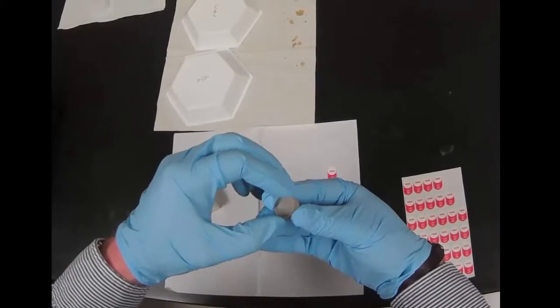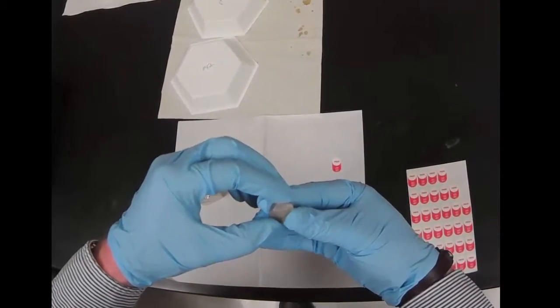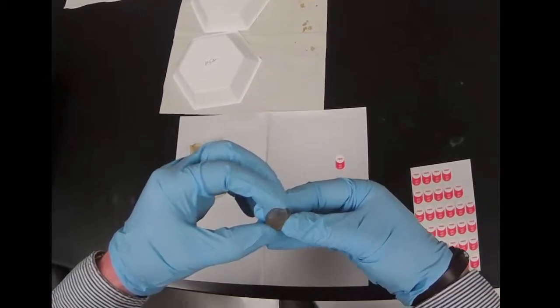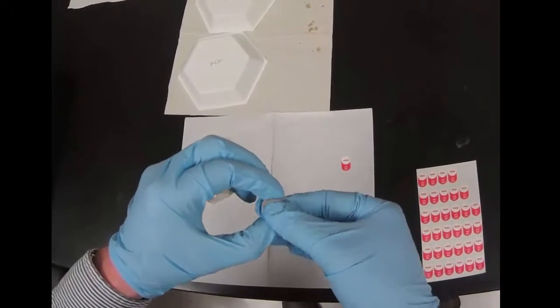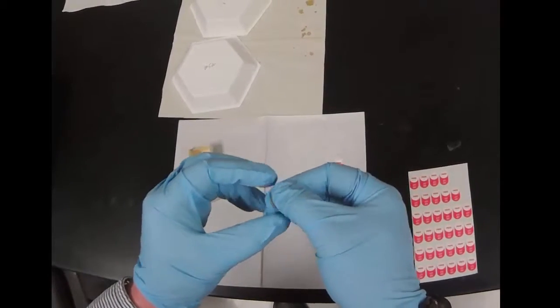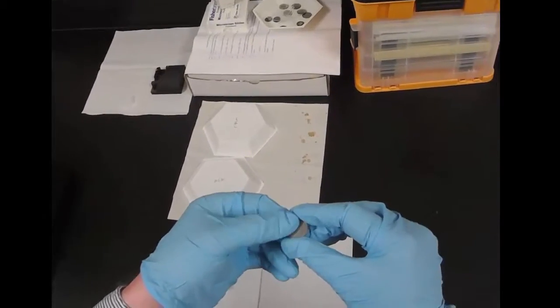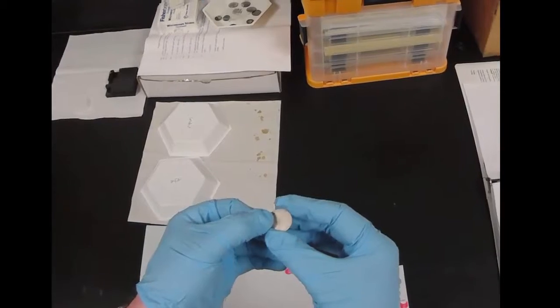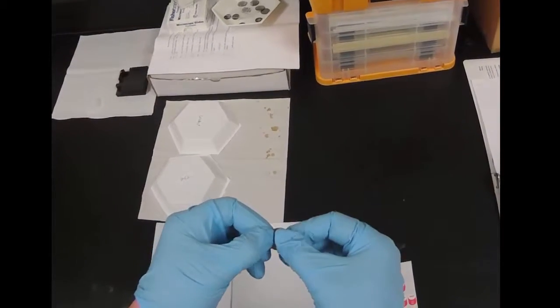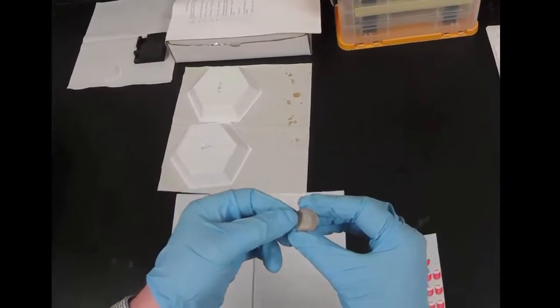Then we can center our glass slide on the steel and press it to stick onto that sticky surface. Then we'll clean this with soap and water and blow it air dry before we use it in the next step.